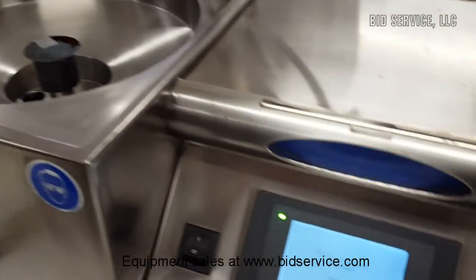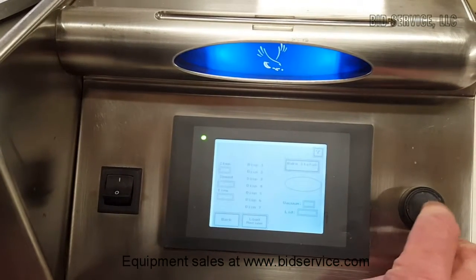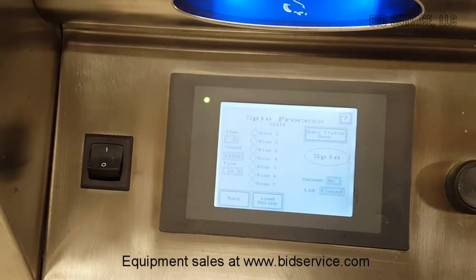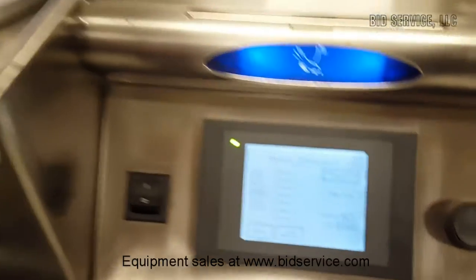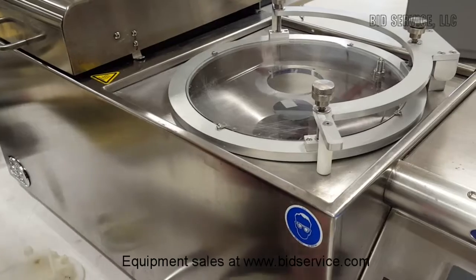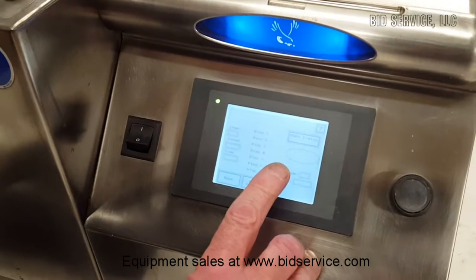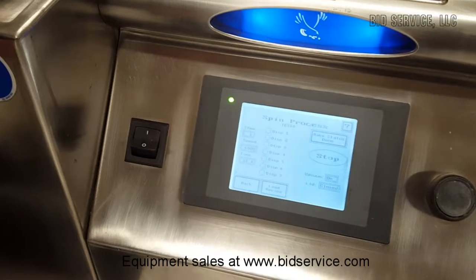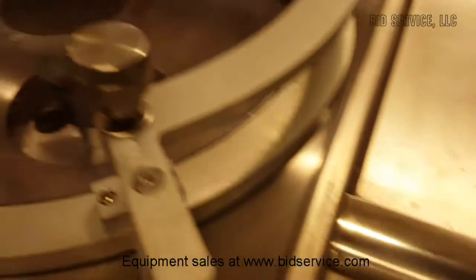The flashing light on the front panel tells you that the cycle is done. Hit stop. Now I'm going to do that again, but this time I'm going to measure the displayed RPM with our very accurate infrared tachometer. There we have it — 6,000 RPM.